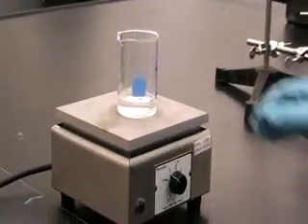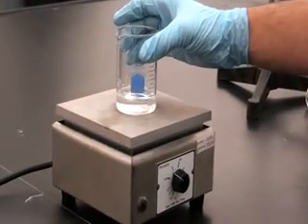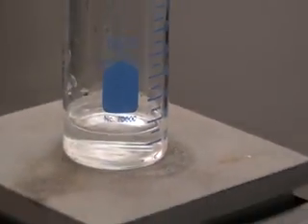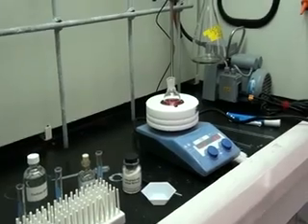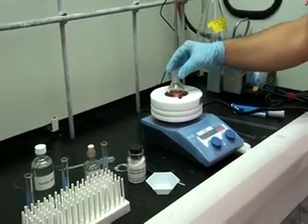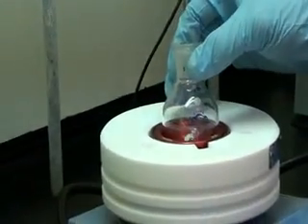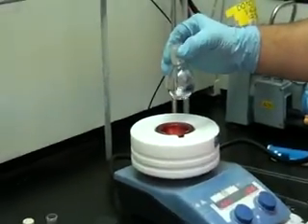First, we begin by heating 15 ml of water that will be used in a later part of the procedure. For the first part of the heating procedure, we will be using a 50 ml round bottom flask with an egg-shaped stir bar.